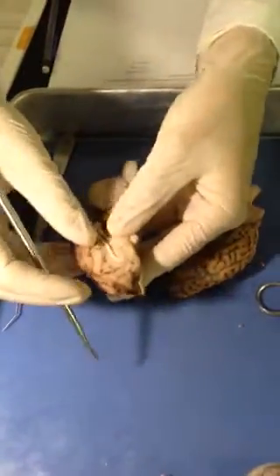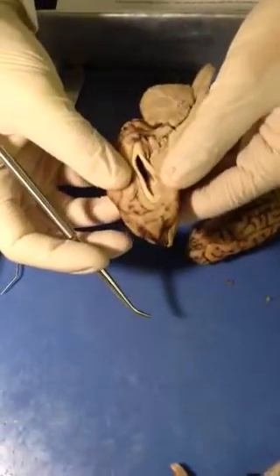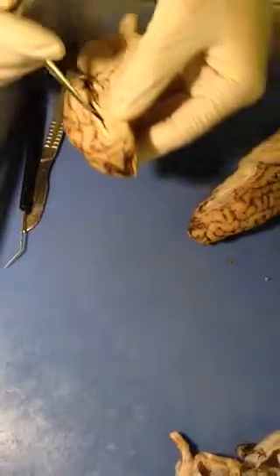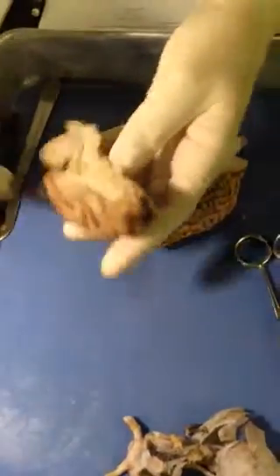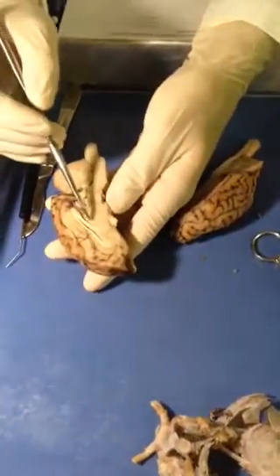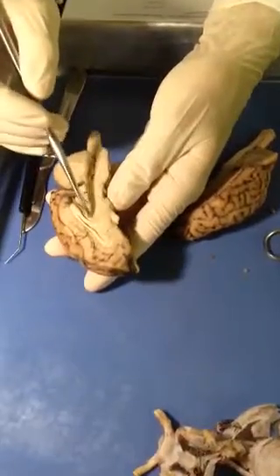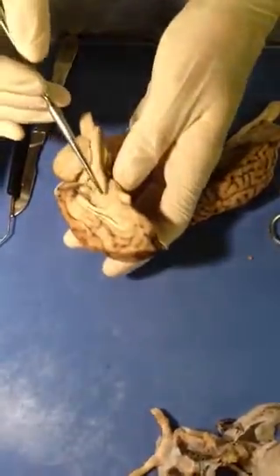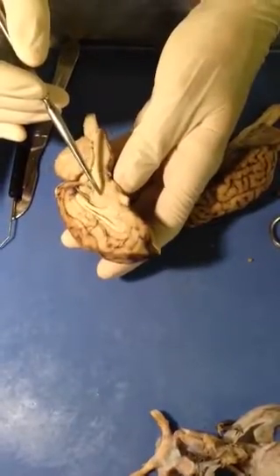Inside the lateral ventricle, you can see the darker area in there. That is the choroid plexus. Just below this here, we have the thalamus, which is at mass there, and the intermediate mass of the thalamus is right around in there.